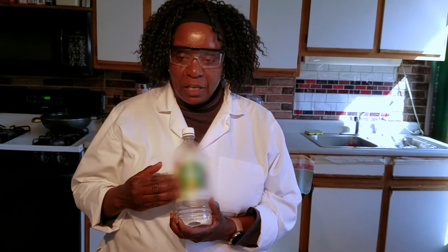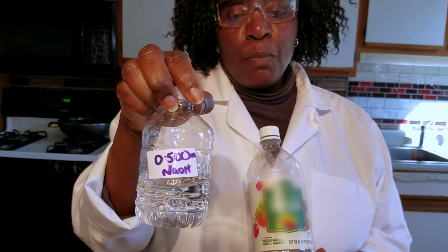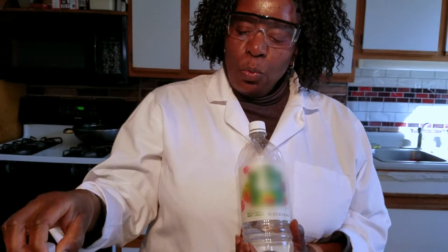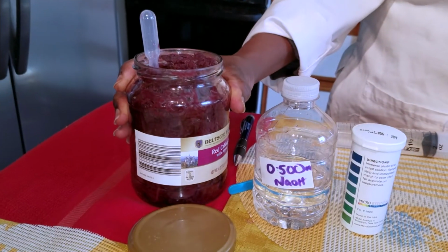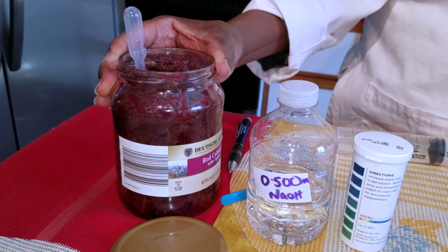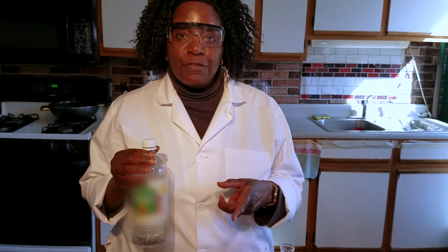We can do this by reacting the acid with something that would neutralize it, such as a base. And in this case, we're using a 0.50 molar solution of sodium hydroxide. And then we're going to use another product that we have been using, which is an indicator. So this is red cabbage dye. What it does is it turns a characteristic color for an acid and a characteristic color for a base. So what you should have in front of you is a data table, and I want to show you what to fill in.